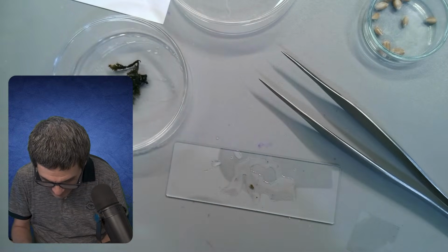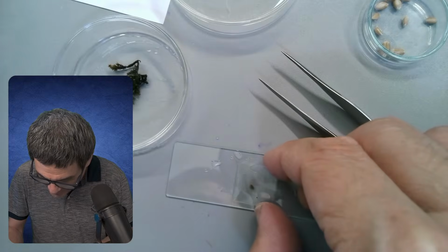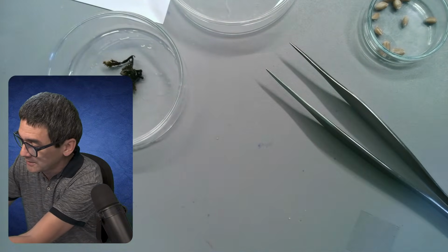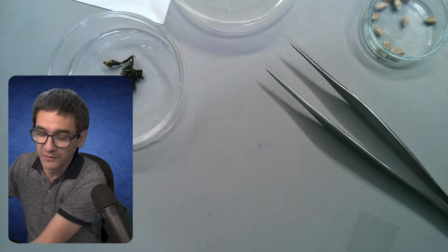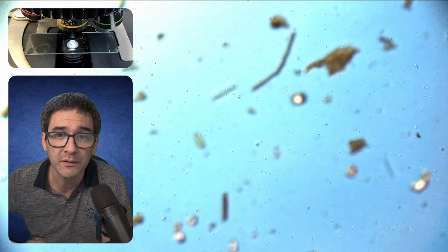As always with those pond water samples, it's a good idea to put some solid material under the microscope and hope to find something there. But sometimes, if there's running water, this also flushes away any microorganisms that might be present.